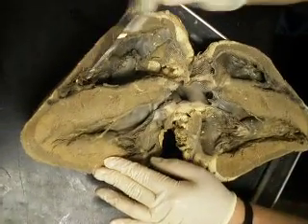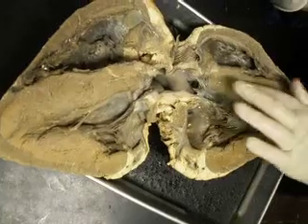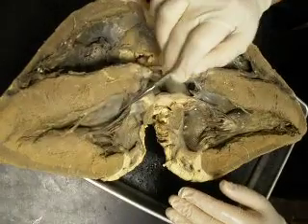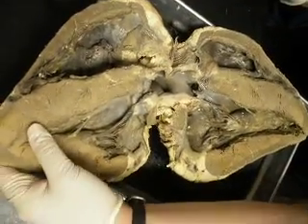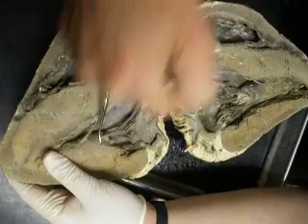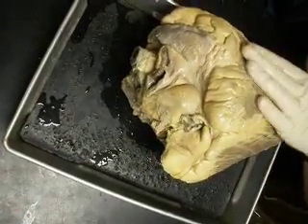Right. And then the other thing on here is just knowing that this is the myocardium. This is all myocardium. This shiny stuff that lines the chambers, that's endocardium. And this is the papillary muscle right there. And this is the papillary muscle right there. That thicker part, that's trabeculae carneae. Okay. And then the outside is the epicardium.